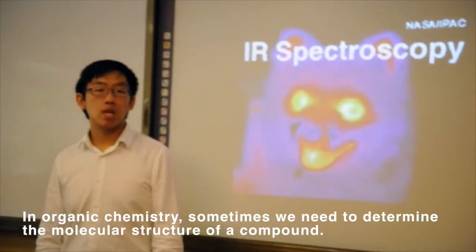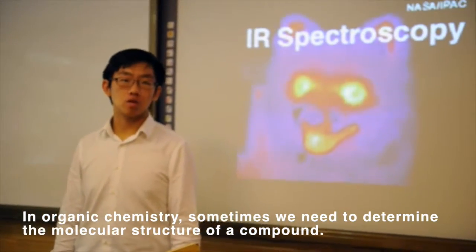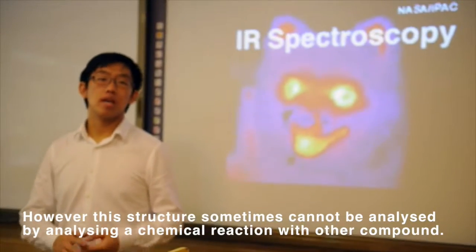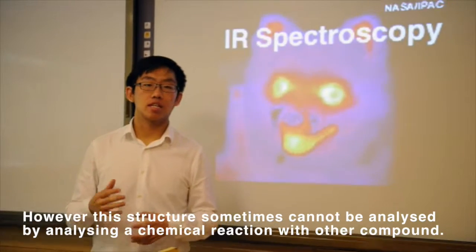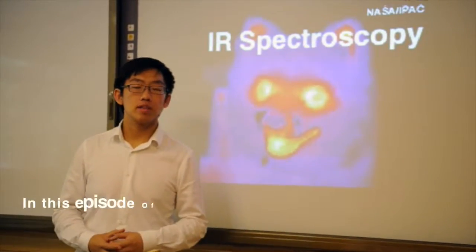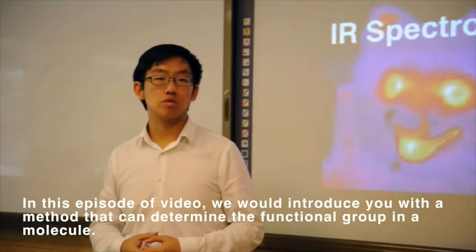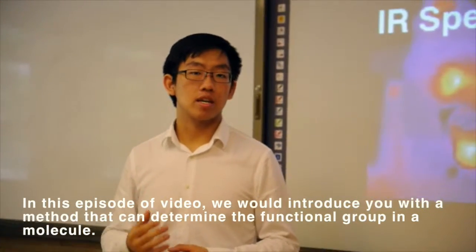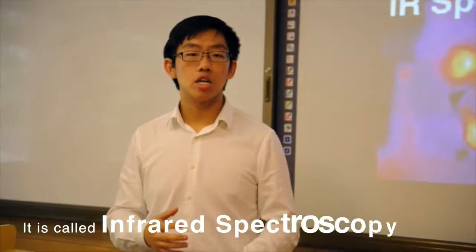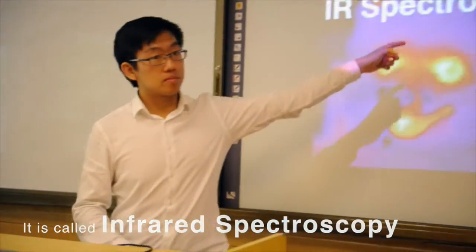In organic chemistry, sometimes we need to determine the molecular structure of a compound. However, this structure sometimes cannot be analyzed by analyzing a chemical reaction with another compound. So we need other tools. In this episode of the video, we will introduce you to a method that can determine the functional group in a molecule. It is called infrared spectroscopy.